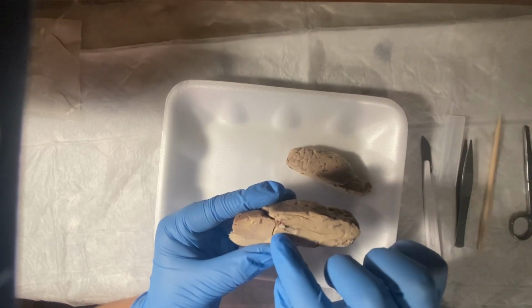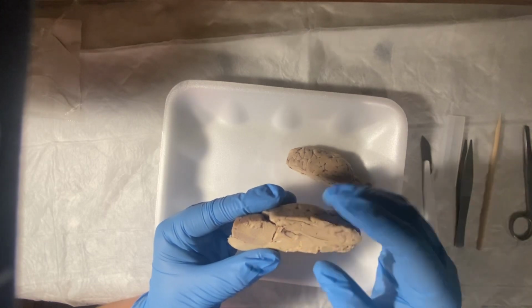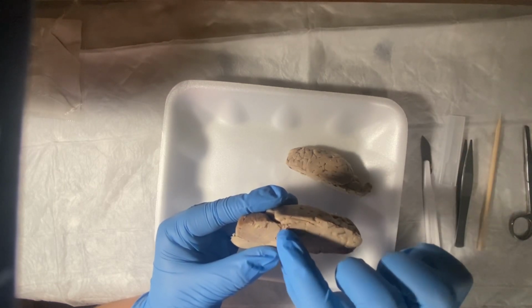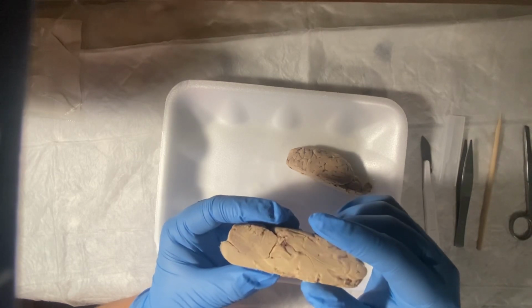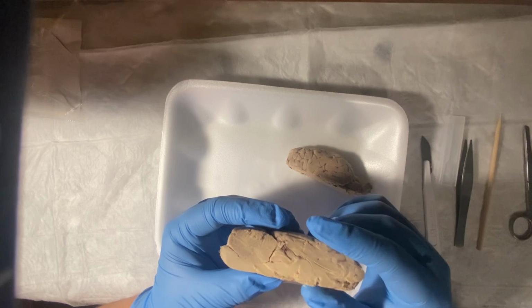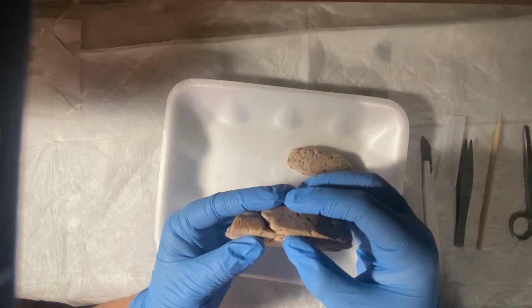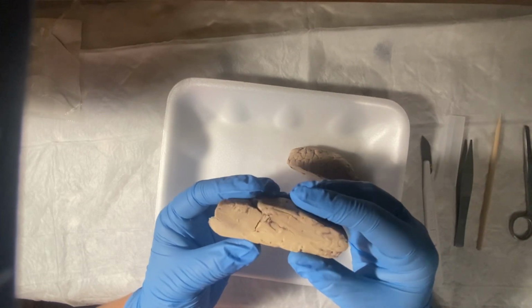It's kind of, like I said, midbrain. I believe it is right here behind the pineal body. Yes, pineal body, and here is the superior colliculus. And so then we'll find the inferior colliculus, and that's just, well, it's inferior. It would be under here, behind, okay? And that is the reflexes to sound stimulus.